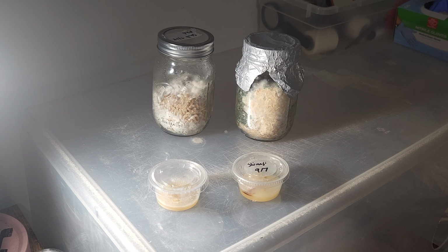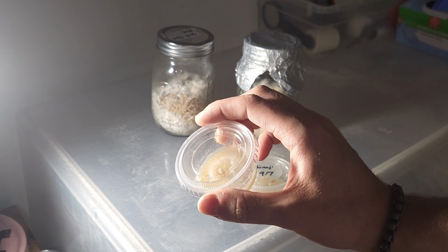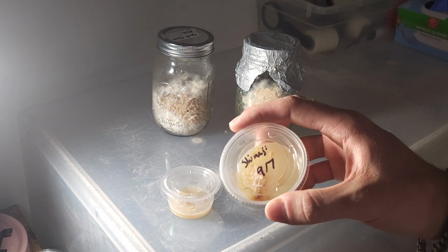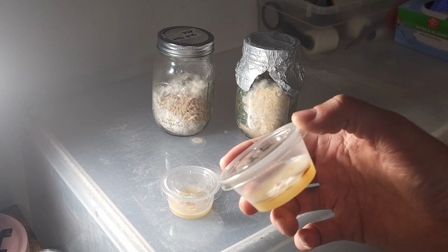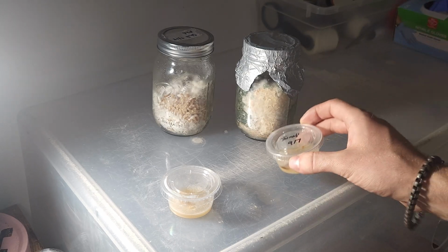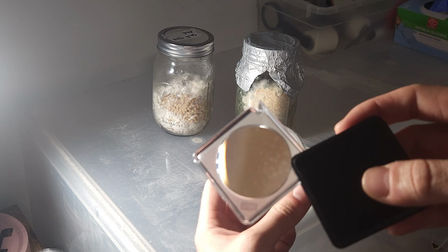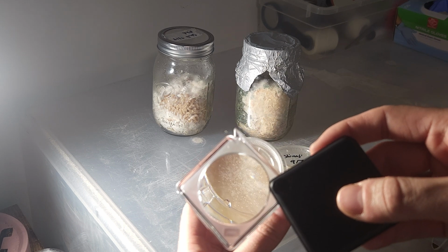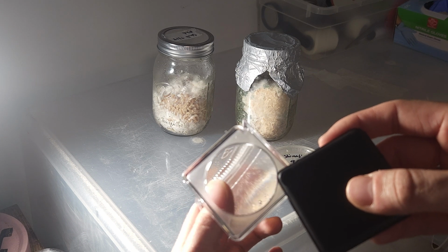Next, let's take a look at these agar plates. Both of these have clear signs of contamination. This first one has some bacterial growth, potentially a mold growing through. And with this one, while we do see some mycelium growth, you'll notice there's a film along the surface. Wet looking spots, such as on this shimeji sample, indicate bacterial contamination, along with the lack of development of mycelium.